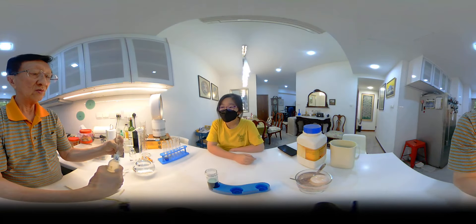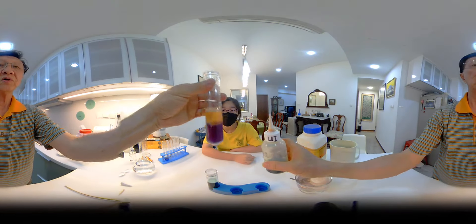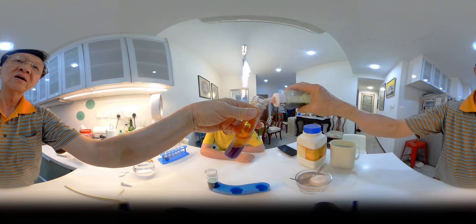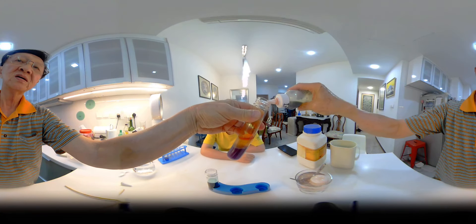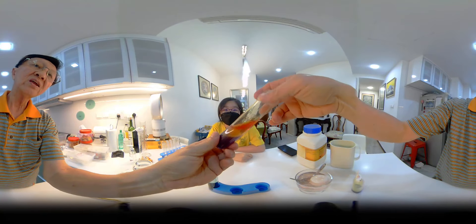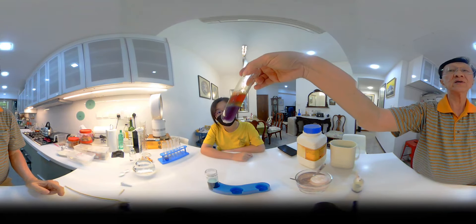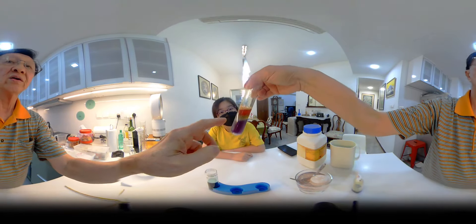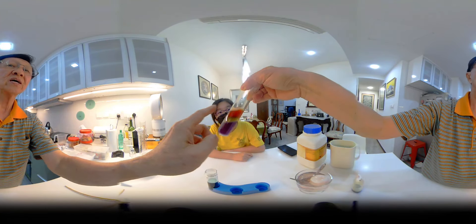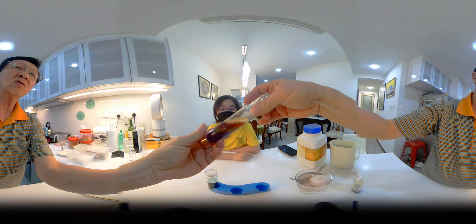We are going to put more UI and see what happens. Of course, the top portion will turn red. Can you see? The top portion will turn red. Green begins to appear. On the green portion, the sodium carbonate is exactly neutralized by the ethanoic or acetic acid.